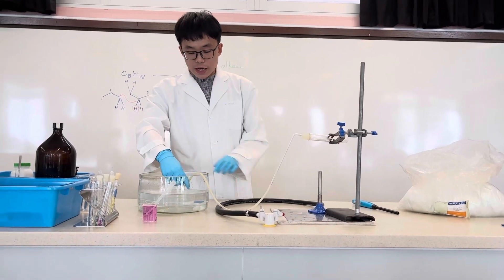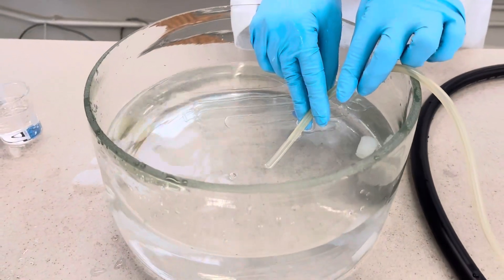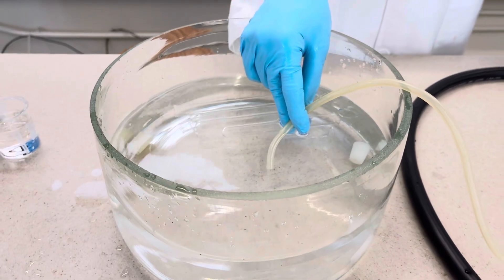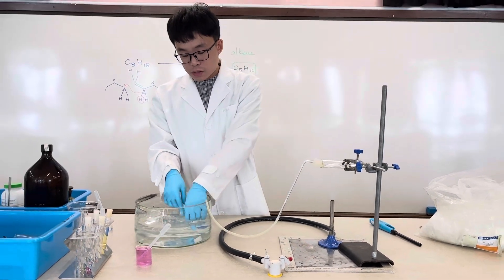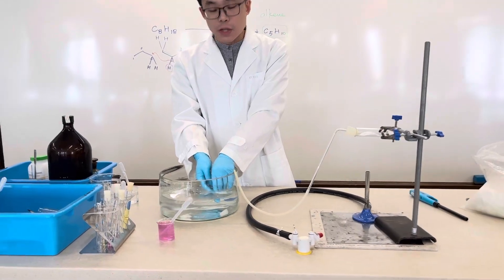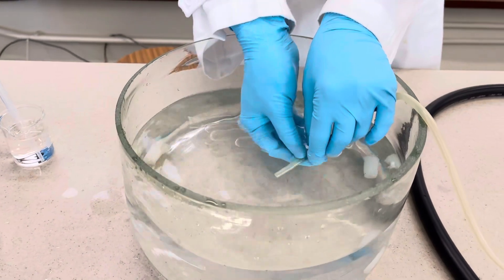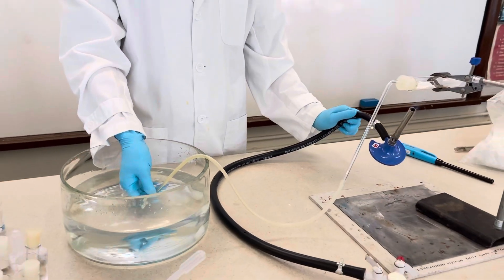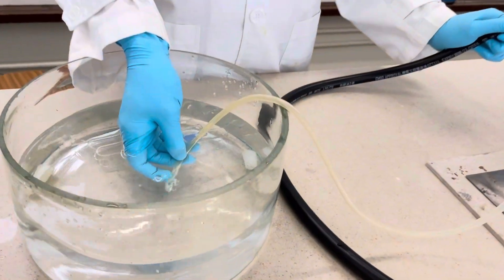You can see already there is some gas being expelled into the tank when we start the flame. I am not going to collect the first batch of gas being expelled — you can tell me in the comments why I do not collect this one. Then when I heat the aluminium oxide, you can see it starts bubbling a little bit.